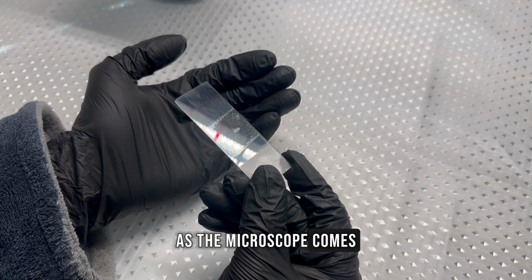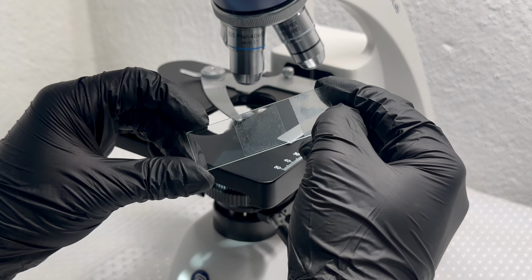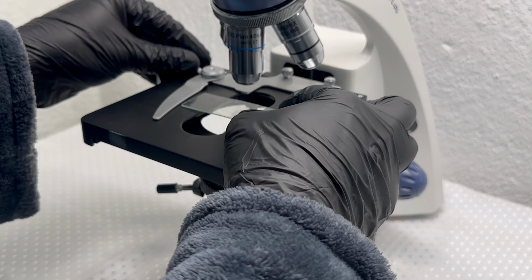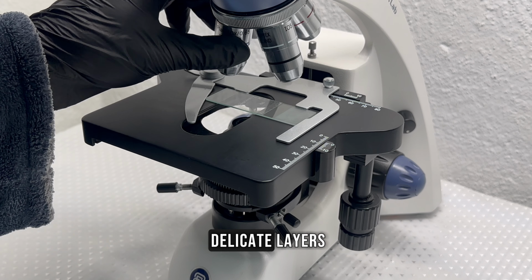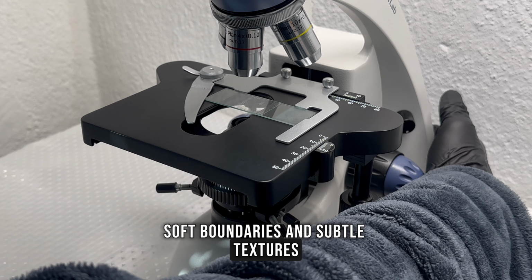As the microscope comes into focus, the familiar fruit begins to change. The smooth surface we imagine no longer exists here. Instead, the mandarin starts to reveal a hidden world formed by delicate layers, soft boundaries, and subtle textures.